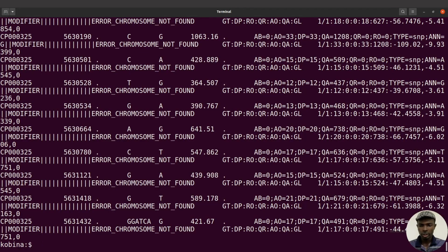So you can proceed. Okay, so it has been done. All right, but with SnpEff, one of the errors that you may encounter is this message here: ERROR_CHROMOSOME_NOT_FOUND.